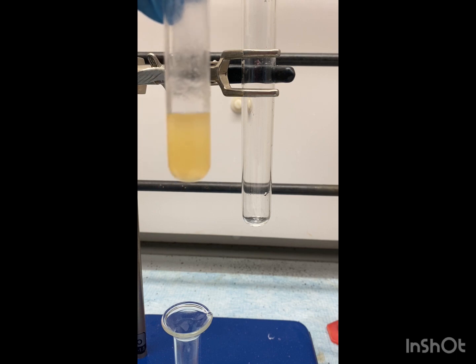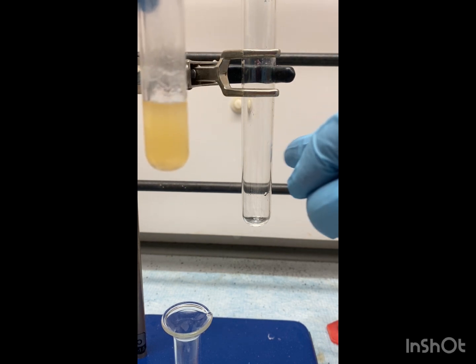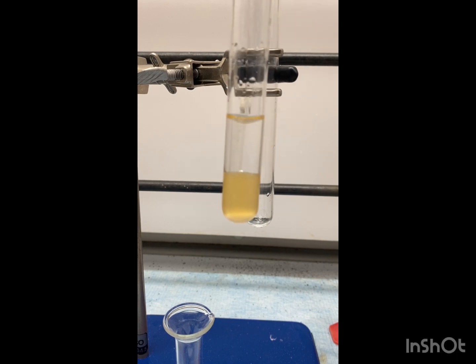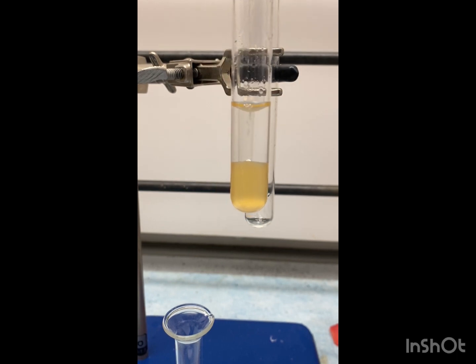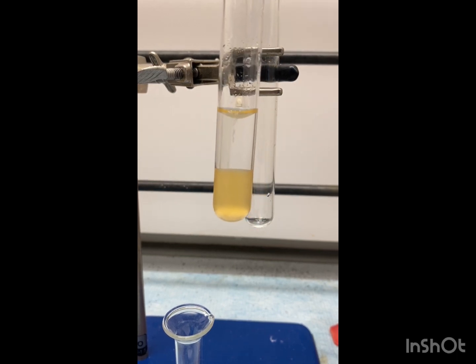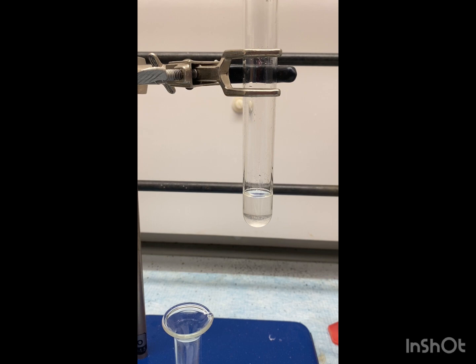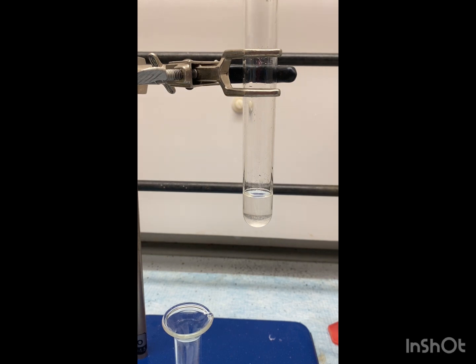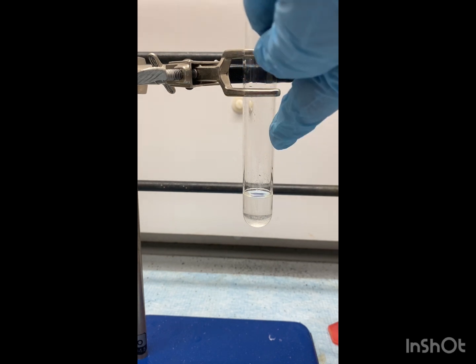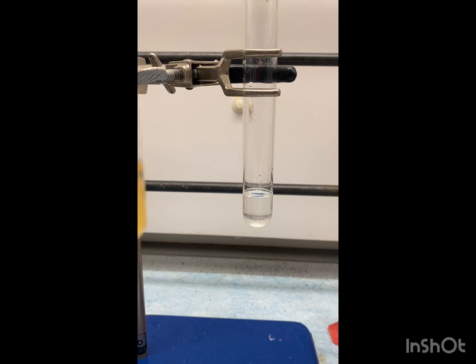We are now going to work it up by adding 3 mL of saturated aqueous sodium bicarbonate, and then we're going to transfer the organic layer to a new test tube. You can see two distinct layers. We're going to extract the organic layer and put it into our new test tube. This is our organic layer — we have removed it and set it aside. Now we're going to take 3 mL of DCM and add it to our aqueous layer, then extract the organic layer again and add it to this test tube.